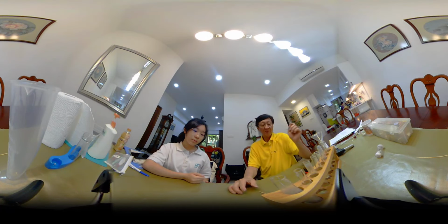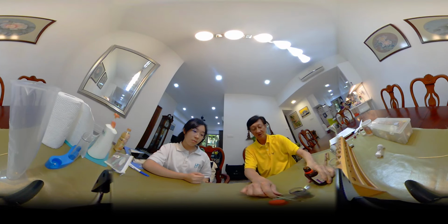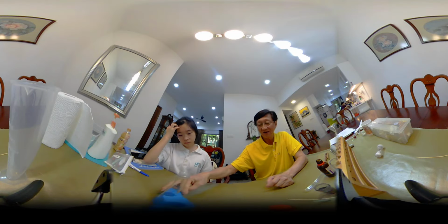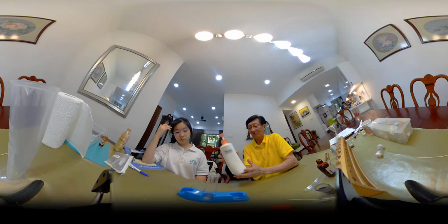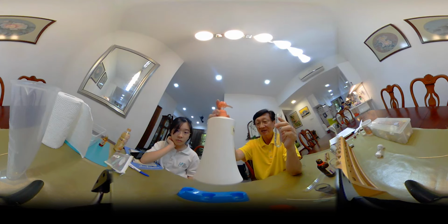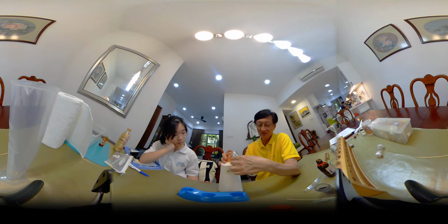Now, this time I want to do something different, which I saw on YouTube. I thought I would try to do this, okay? Now, I put a little bit of dishwashing liquid. A little bit of dishwashing liquid.